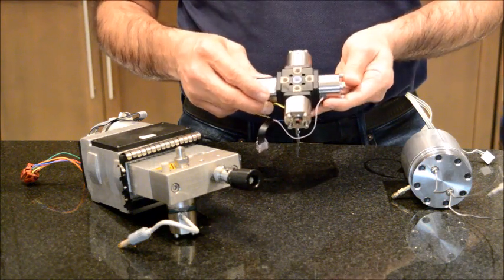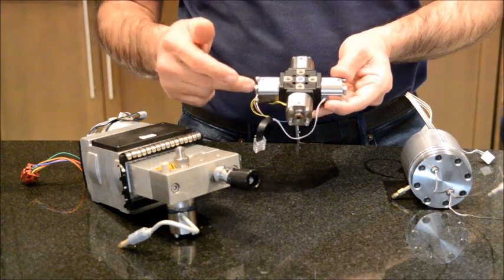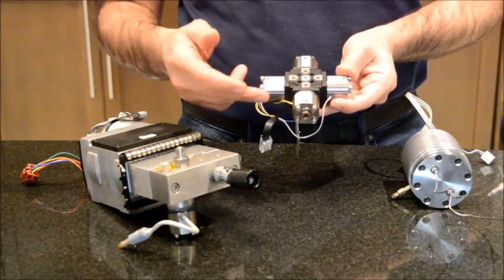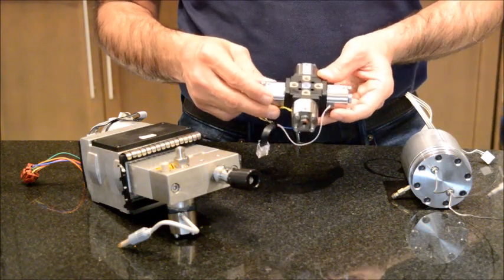After washing, your metrology team will probably do a gradient proportion valve test and they will give you the okay that the system is working fine and you start using it again.